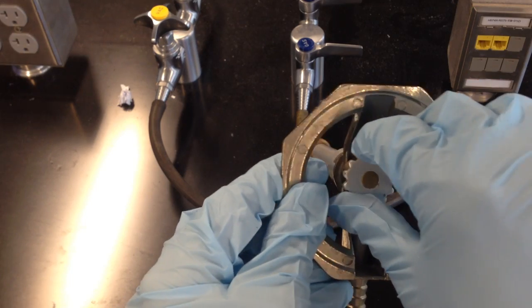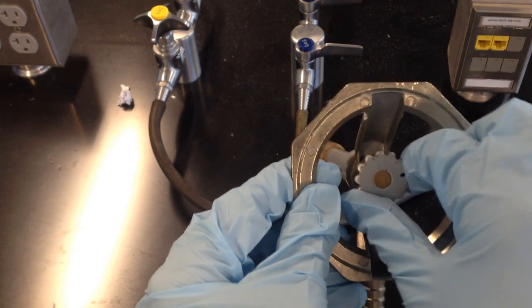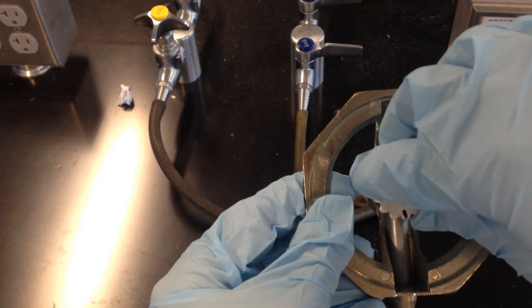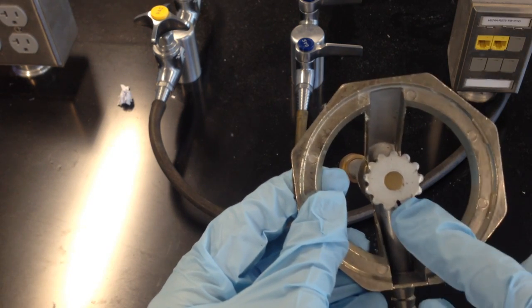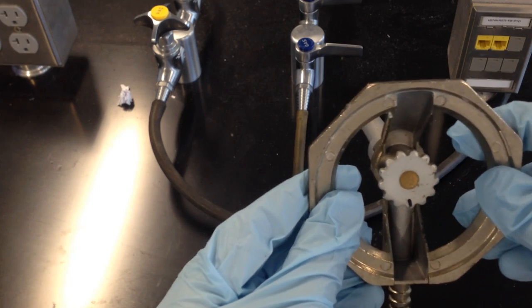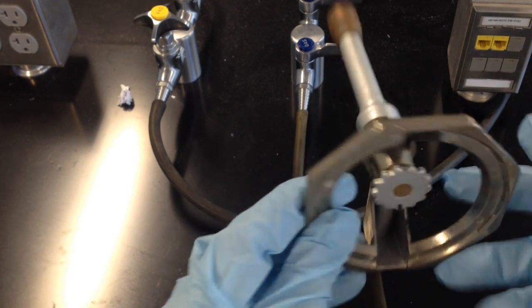In general, about one turn around this bottom valve is going to get you a good gas flow. So go ahead and turn this about a full turn, and you'll notice that the black mark has come back around, so we've rotated that about 360 degrees. That controls the flow of gas through the inlet.